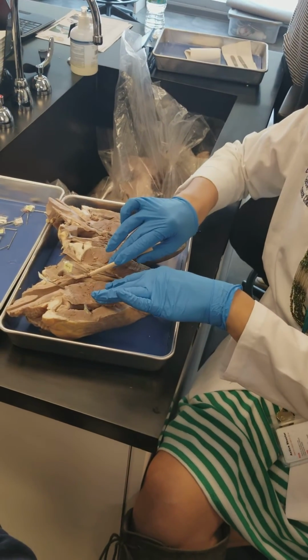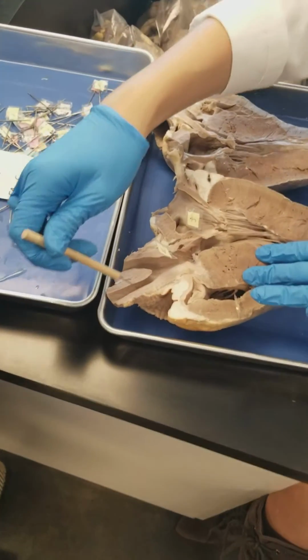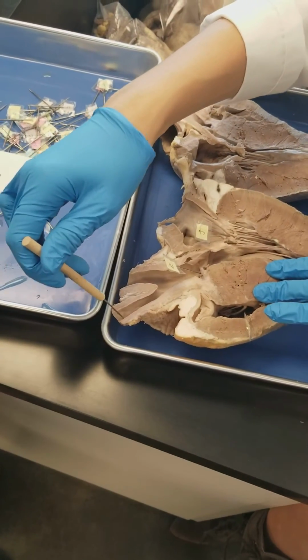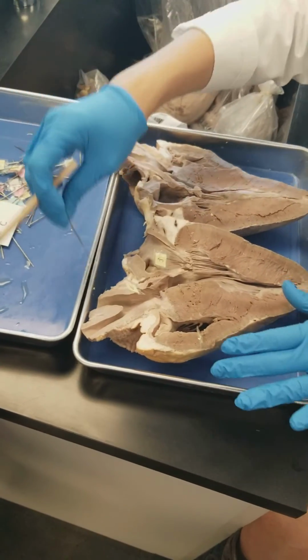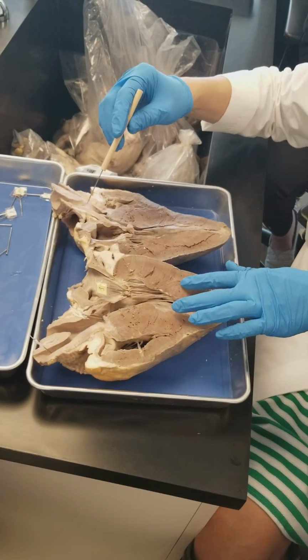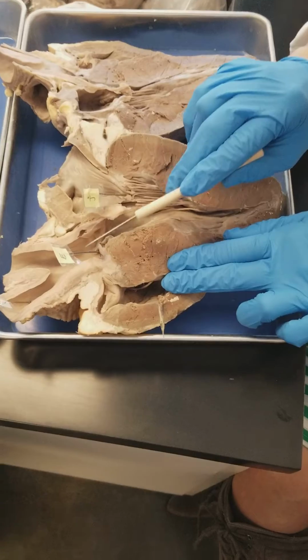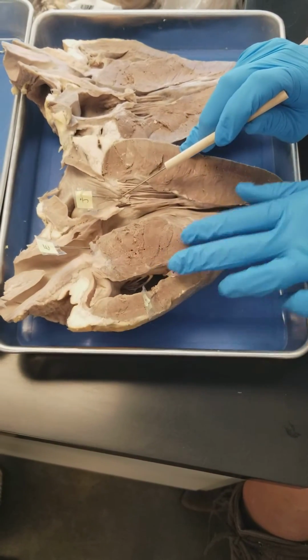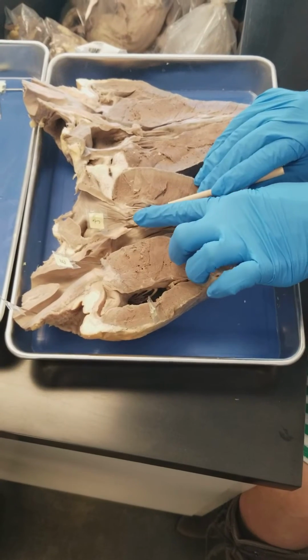And this is the aortic valve right here. Right? And this would be the aorta. And that would be the first branch off the aorta, which is the... Coronary artery? Brachiocephalic. Okay, so brachiocephalic. And so letter E would be aortic valve, right? Letter J would be which valve? If it's in the bicuspid, right?